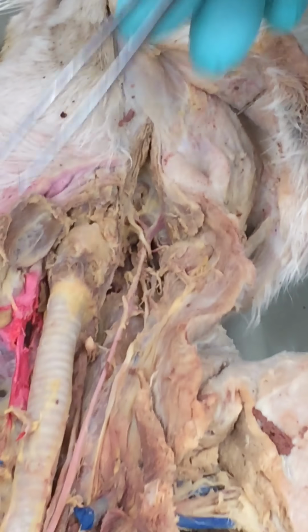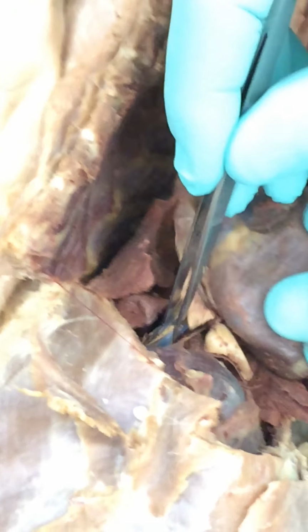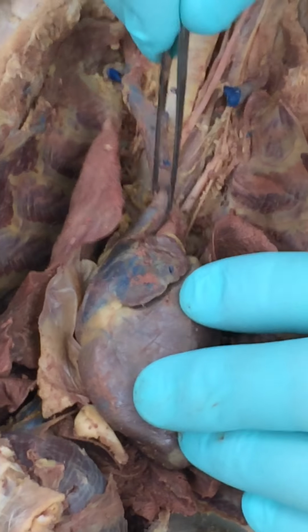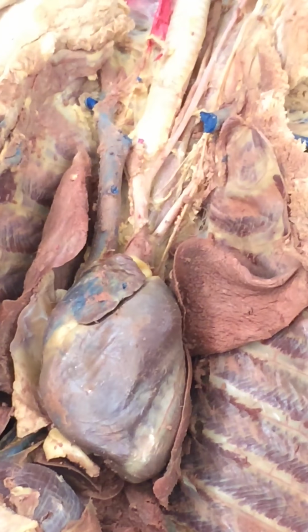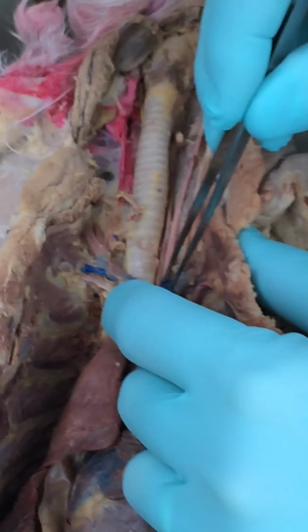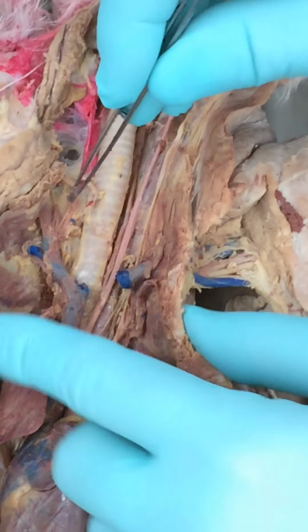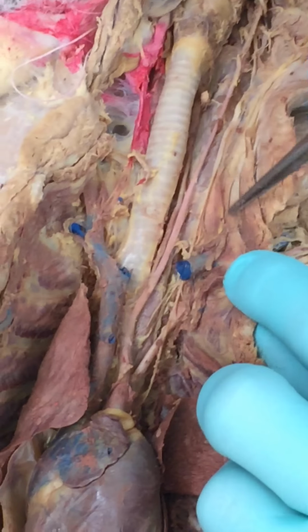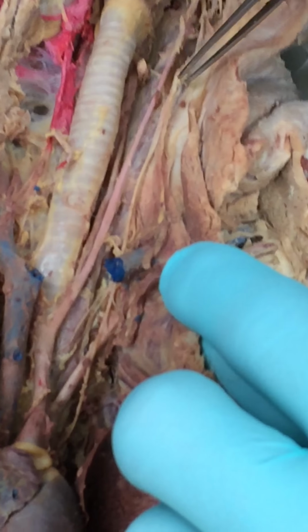Now, come back down, let's take a look at the veins. Right below, there's the inferior vena cava. Here's the superior vena cava. Superior vena cava comes up and it branches kind of like a Y. So this should be like that, but it tore. But this is the right and the left brachiocephalic vein. Brachiocephalics then branch again, and right here I can see it. It's got a little bit of blue right here.